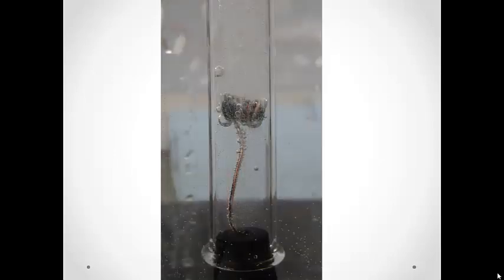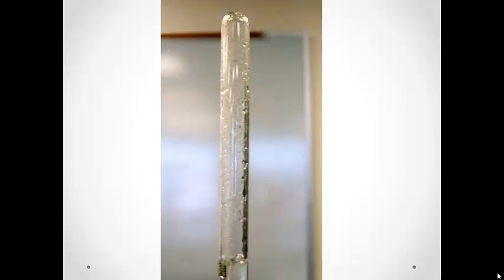Look closely at the tube and you will be able to see the liquids moving. Hydrochloric acid is more dense than water, so it will make its way down to the other end of the tube. This is where it will begin to react with the magnesium metal and gas will begin collecting in the top of the tube.